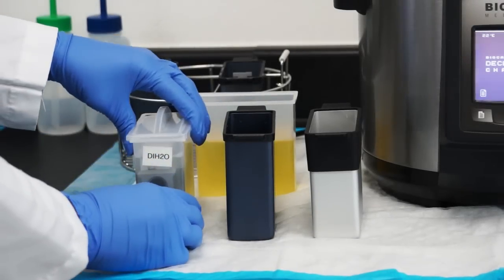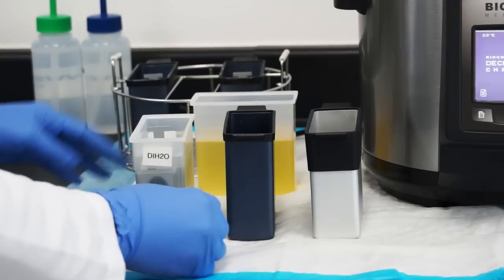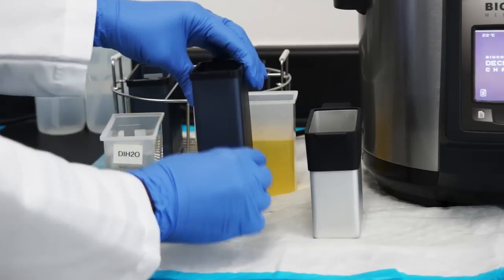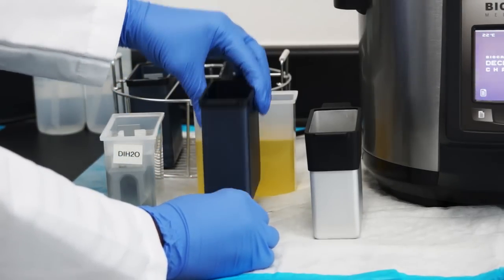Next, load your slides into one of the decloaking chamber next-gen's specially designed metal canisters, along with your BioCare retrieval buffer of choice.